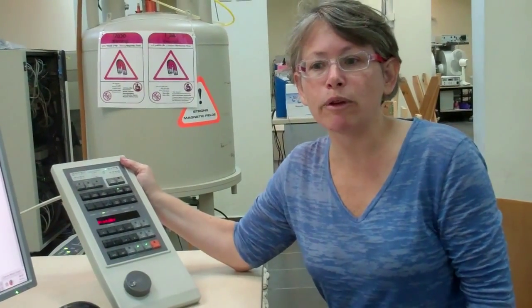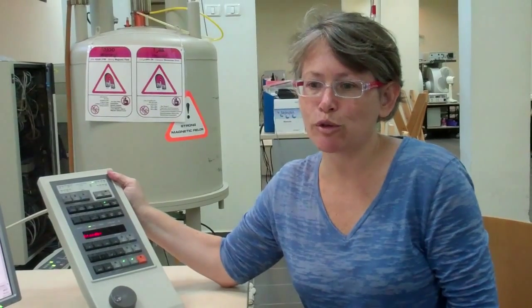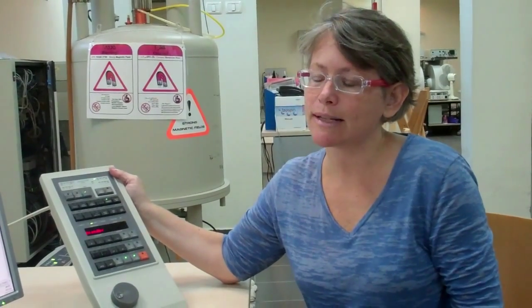If we were to spin more slowly, we wouldn't average the x and y axes. If we were to spin the sample too rapidly, the vortex created in the center of the solution would make the situation worse than not spinning at all.